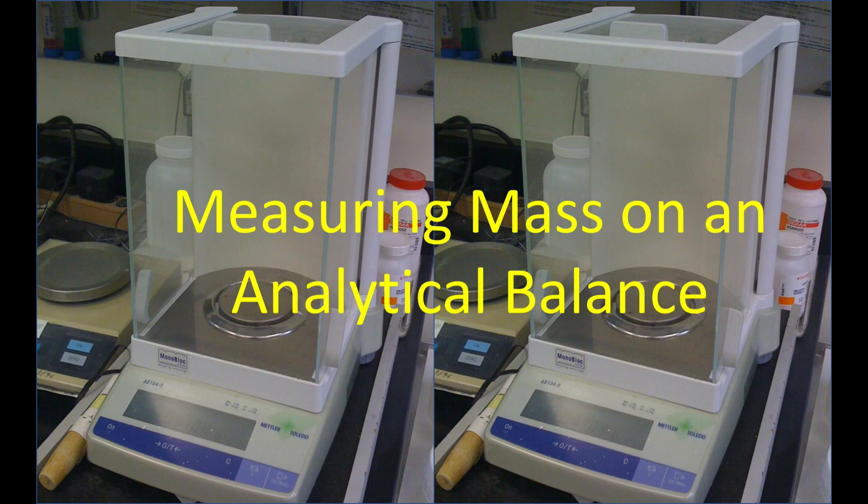In this video, we will look at how to use an analytical balance to measure the mass of material that we'll use.